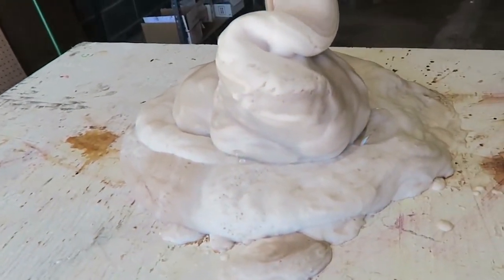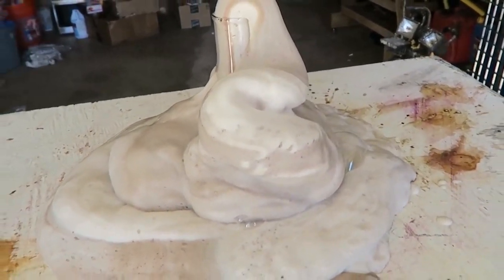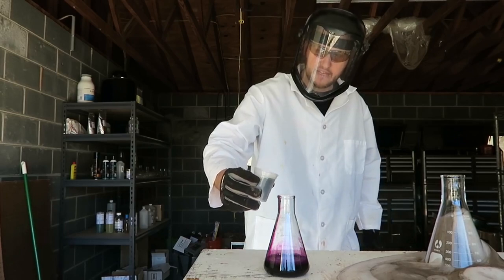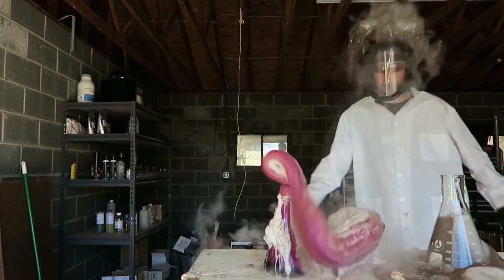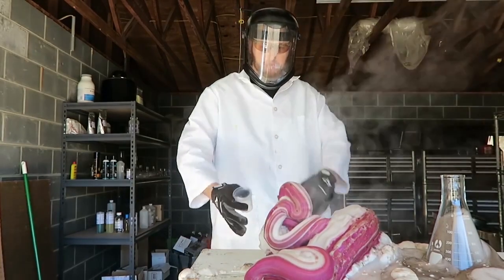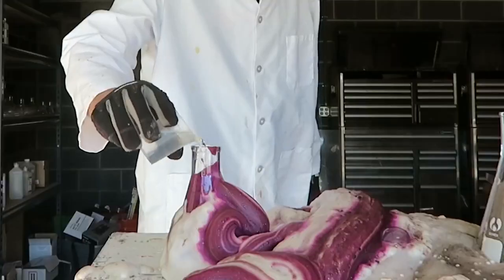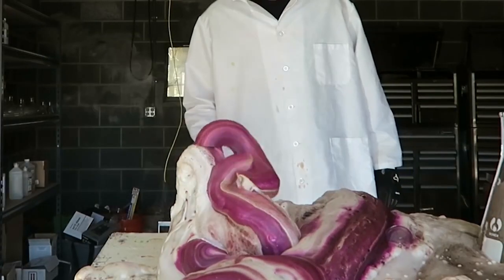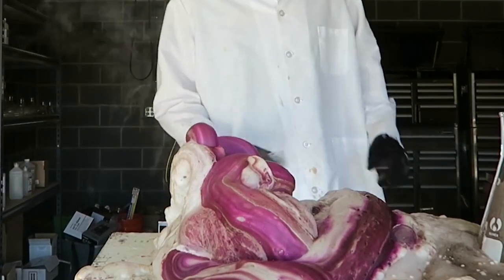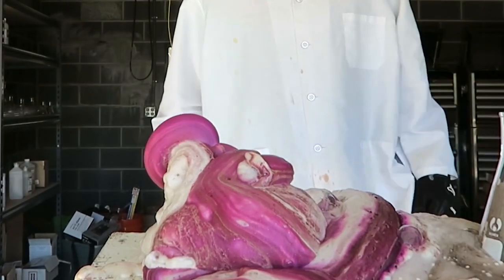Let's try putting a little bit more potassium permanganate. Hydrogen peroxide 35% food grade. And let's go — whoa! Did you see that? They just popped out so fast, that was awesome! This is another way to make elephant toothpaste.